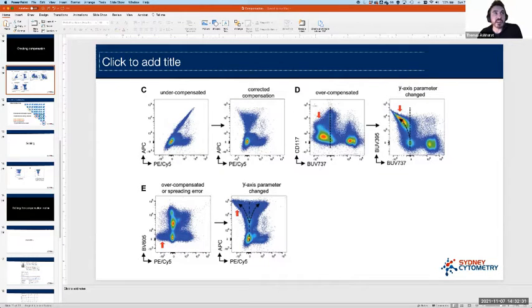What we're going to look at is three principal problems, and in different ways they might manifest. There are three here, C, D, and E. The first is undercompensation. This is where we've got that leaning population where, before, the objective was to move this to the right. In this case, it hasn't been corrected. It's almost like it hasn't had any compensation applied. Typically, it's not that no compensation has been applied, it's more that there hasn't been enough of a compensation value applied. So we call this undercompensation because it hasn't been sufficiently moved to the left. And this is the corrected version, where the median of the positive should roughly line up with the median of the negative.